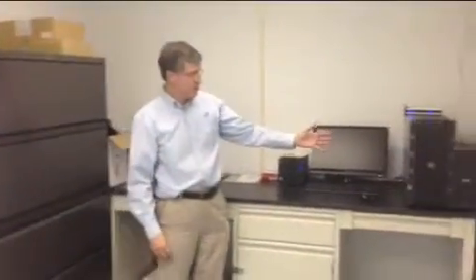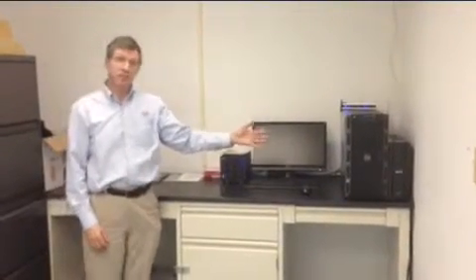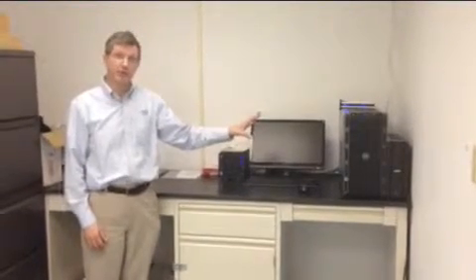So this is our archive and server room. So we actually store our laboratory notebooks and the reports and other materials related to the projects we do with our clients here. And over here is our server with the backup UPS system. So this is the system that we actually store our data on, and it automatically generates 3 copies of everything, raw data and anything else we put on here.